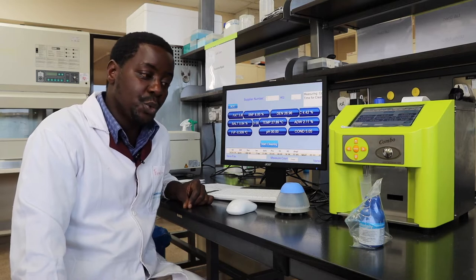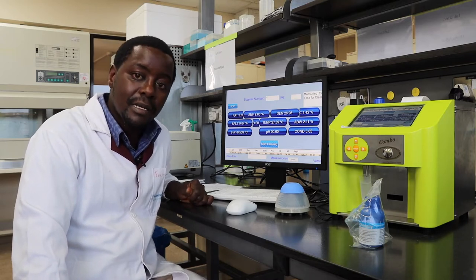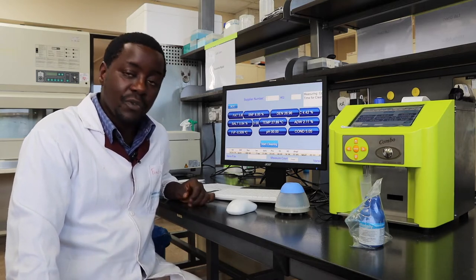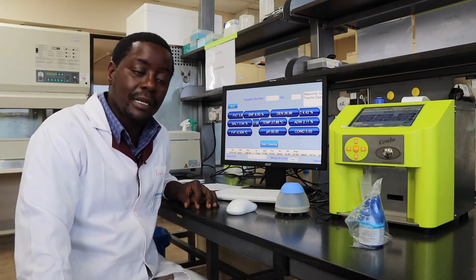The instrument has several recommended cleaning procedures which you need to do. You have the daily cleaning and the weekly cleaning. For the daily cleaning, this is known as the periodic cleaning.